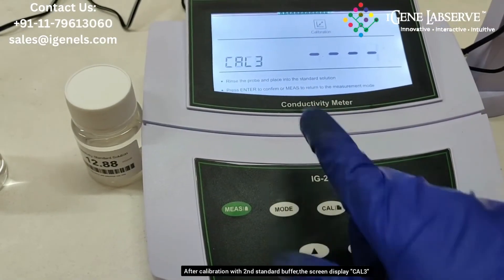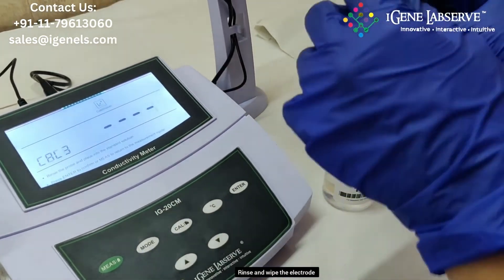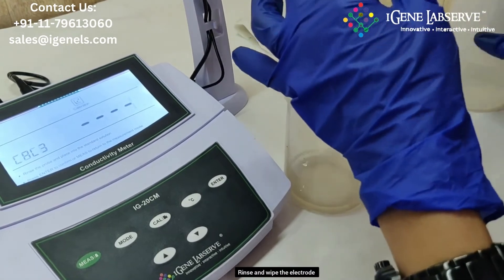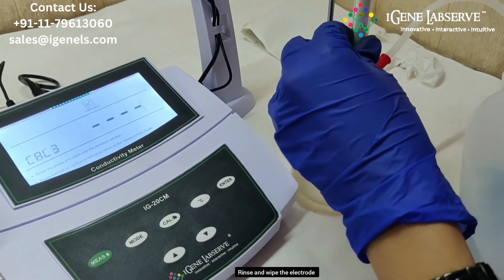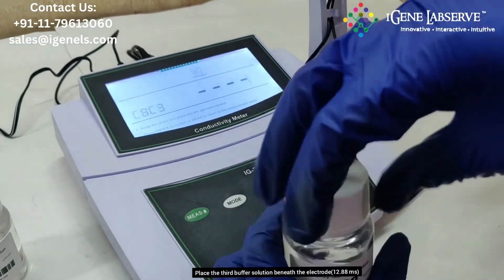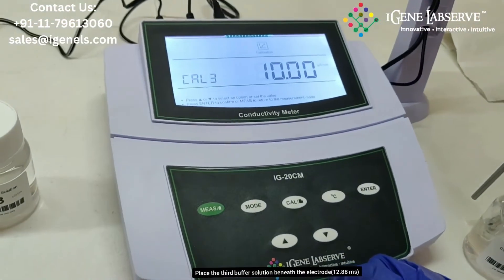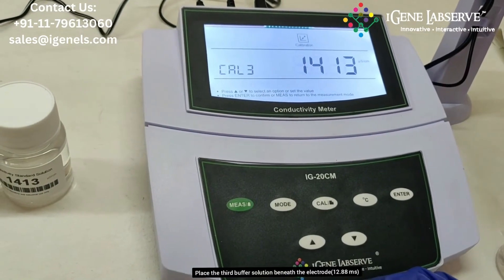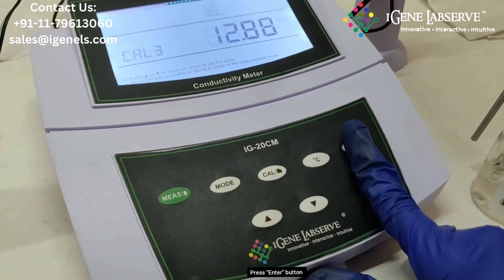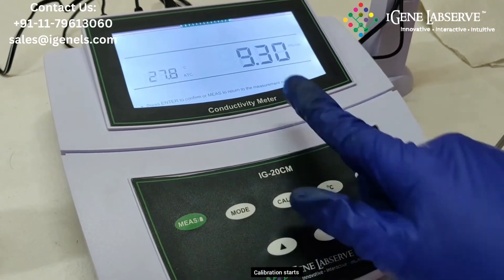After calibration two is completed, it goes to calibration three automatically. Remove the electrode, wash and wipe it for the next calibration. Take the third calibration buffer, dip the electrode inside it, and once it automatically detects the standard solution, press enter and it begins to calibrate.